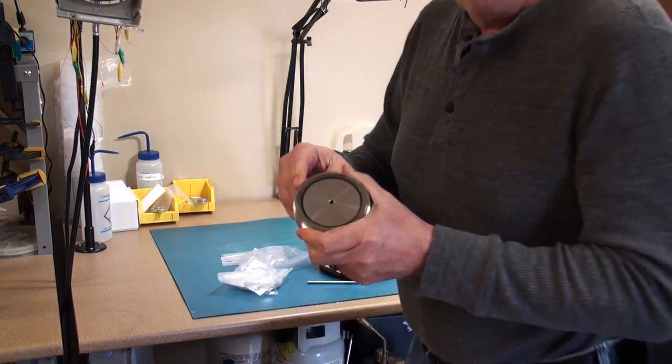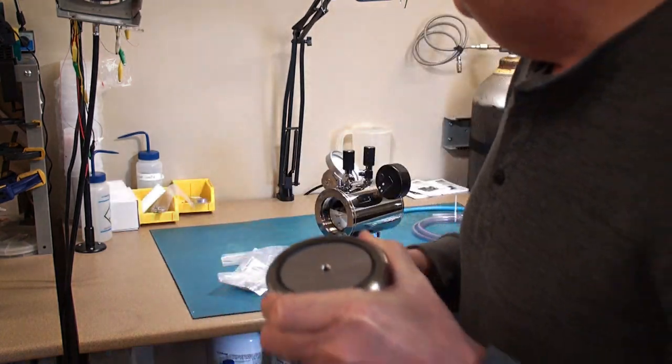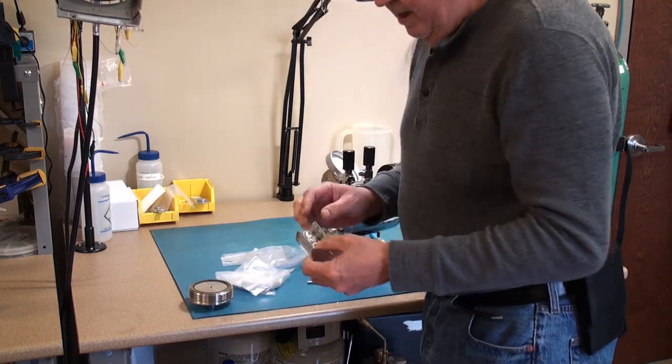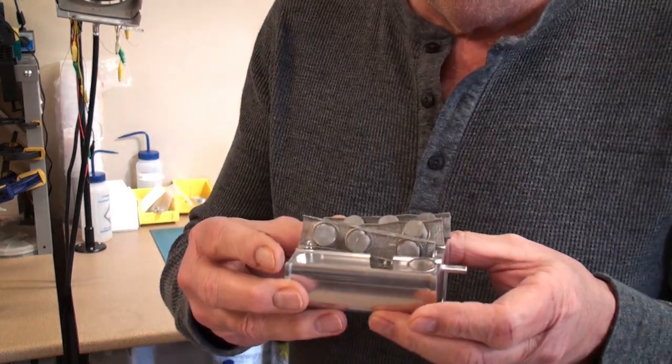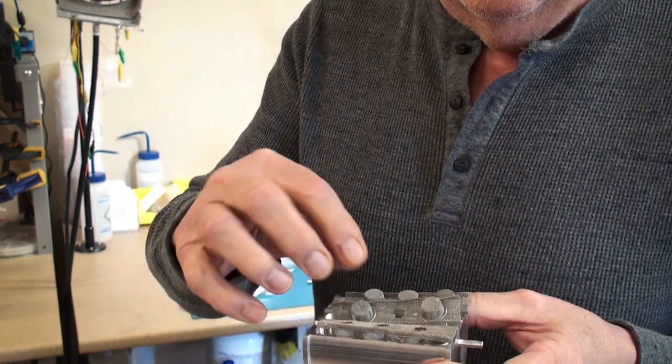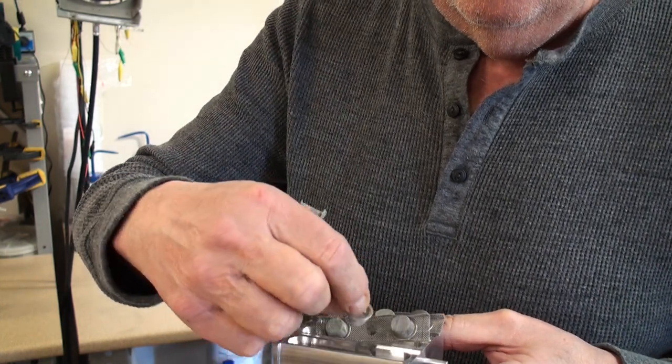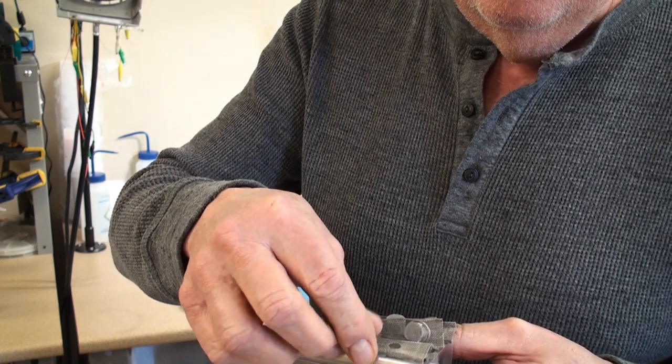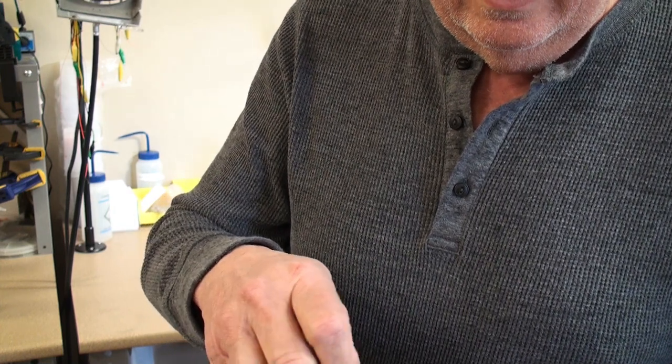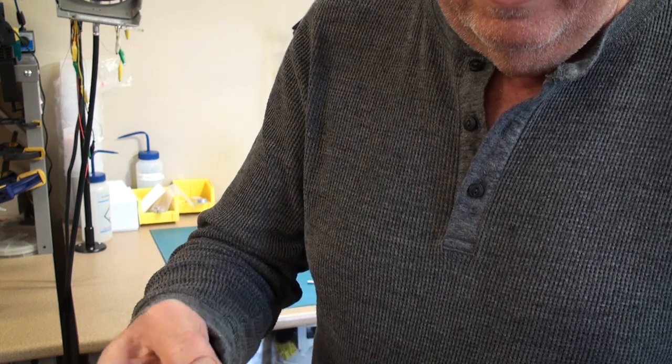Quite a number of threads on it. It comes out and has an O-ring seal on it and you always want to make sure that that O-ring is clean inside the unit. The other thing is a chamber which can hold several samples. Of course this is all dependent on what kind of samples you're working with.